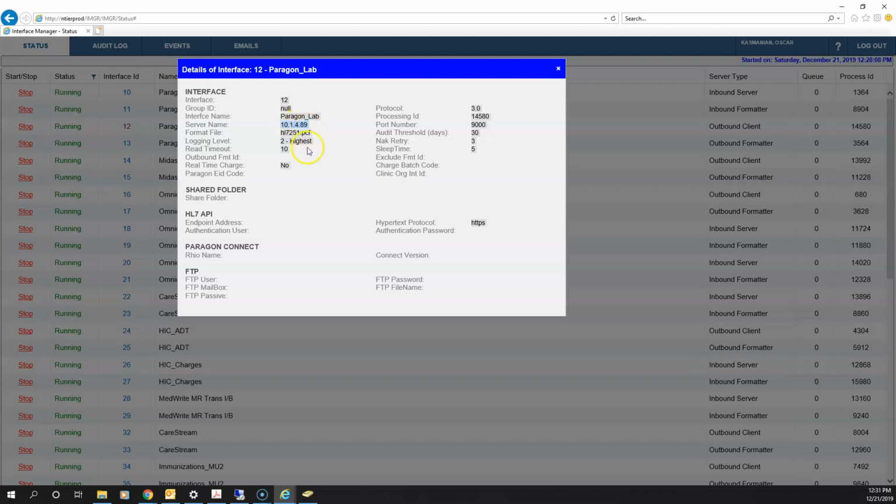If I try to RDP, or if I try to ping into this IP here and I'm not getting a response, that means that the DI is down, and that's where your issue is. That actually means either the DI is down, or maybe somebody is doing maintenance and we weren't made aware of it. Somebody changed the IP. Could mean a lot of things. Most of the time, if you're not able to ping it, or if you're not able to connect, the DI is down, and you'll have to call the lab to go ahead and restart or to turn on the DI.